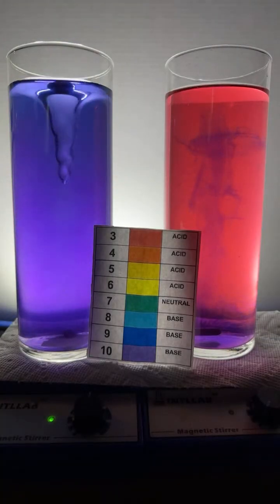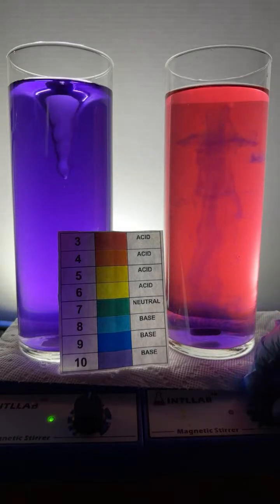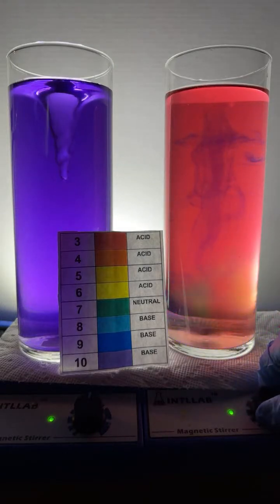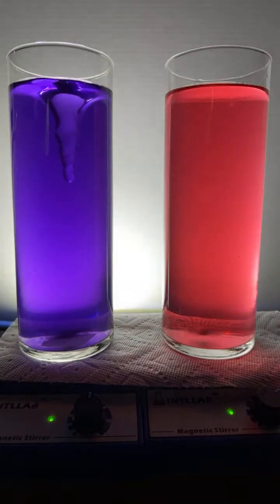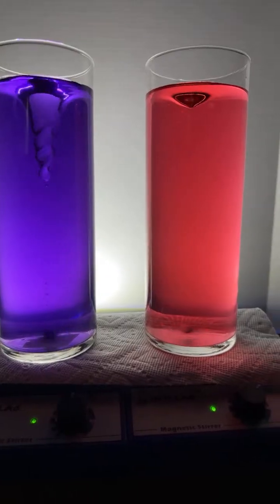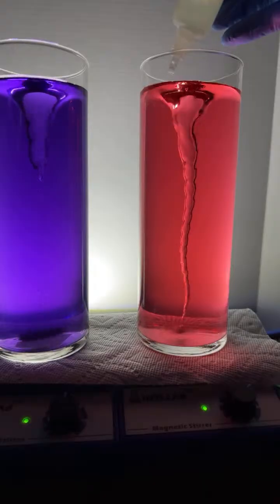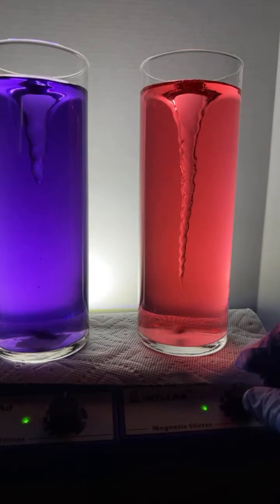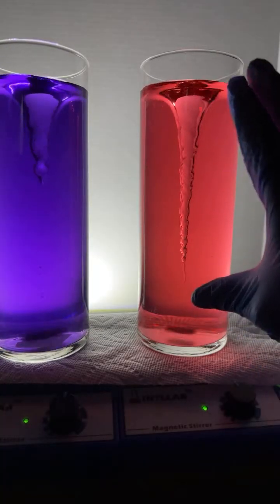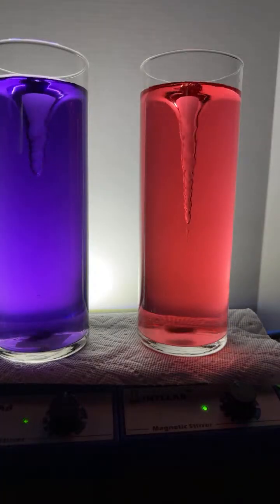So Ryan says they have no idea what a titration is. Would you please explain? Sure, Ryan. This is what we're going to do over here. We're going to do a titration on this side. I'm going to go ahead and mix this up. We're going to do this on the right. This is not a real titration. It's just for demonstration purposes. Then, Ryan, I'm going to add a little excess of acid over here. So there's quite a bit of acid in here. And let's say I just happen to put in a carefully measured amount of acid in here, okay?